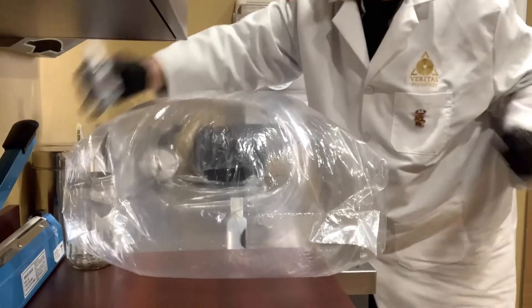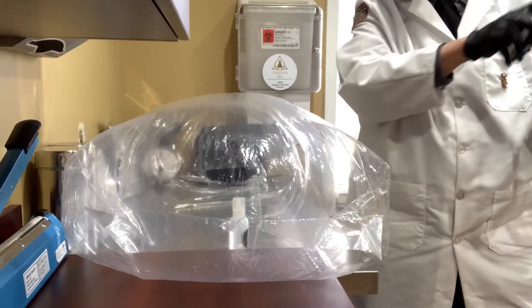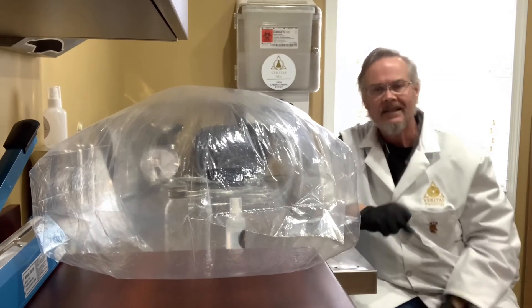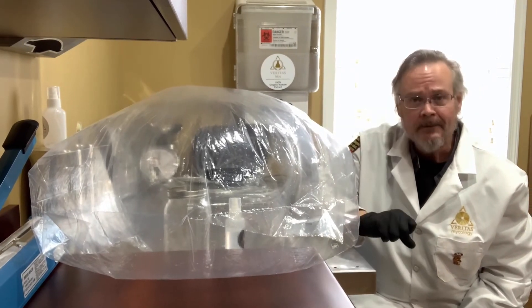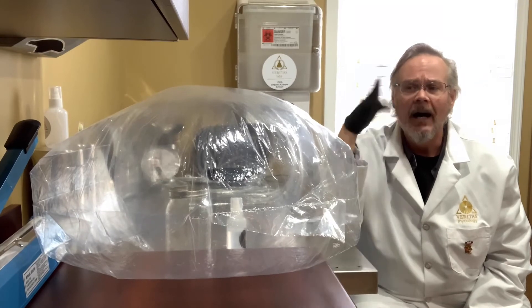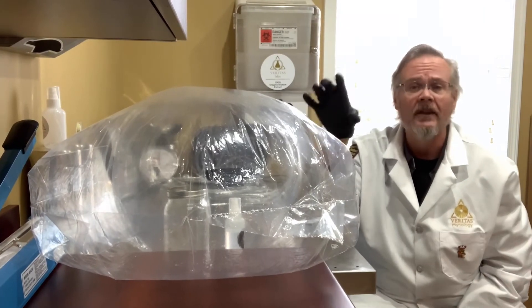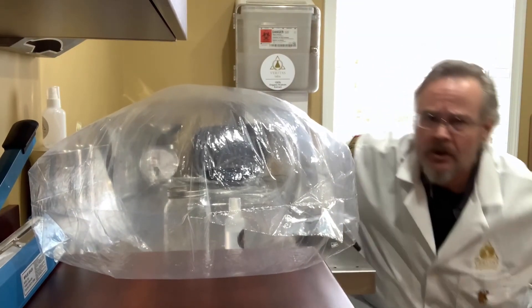If you've got another ISO bottle, you can ISO down whatever you've got going in. Work on it and tweak it so that it works for you — if you don't like my way of doing it, do it yourself, that's cool. That's part of experimentation; I just want to give you an idea to work with. For less than 60 bucks — maybe 65 — I've never found a dry cleaner that charged more than a dollar or two, and that's for a huge quantity of bags. They're very generous. These bags are very cheap and very light, and this makes for an excellent flow hood.